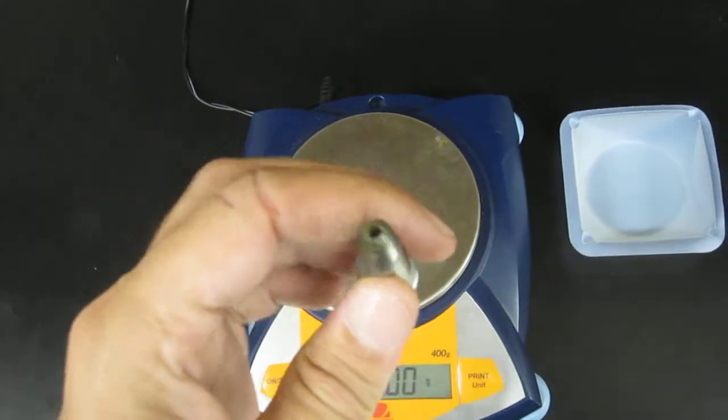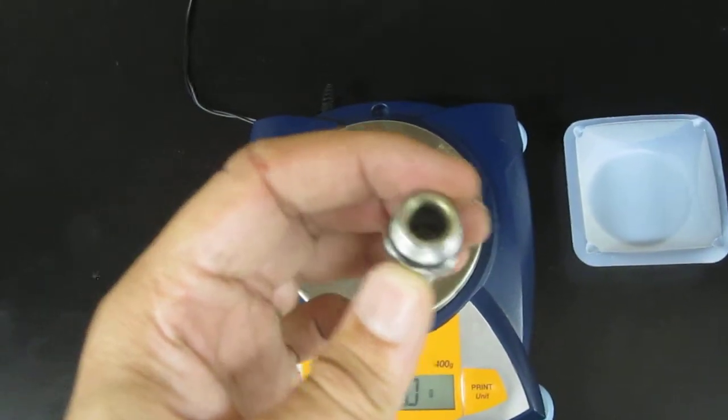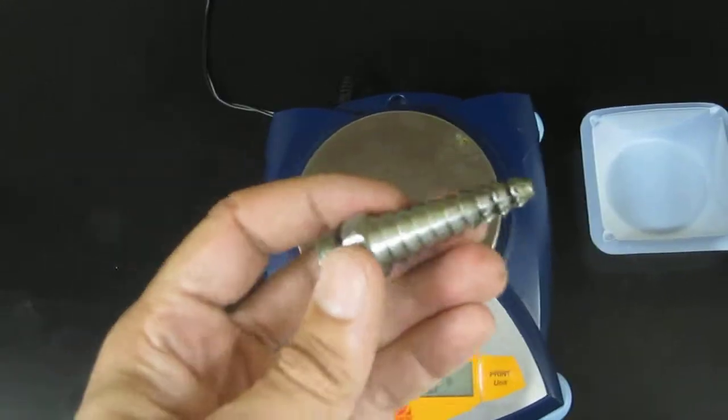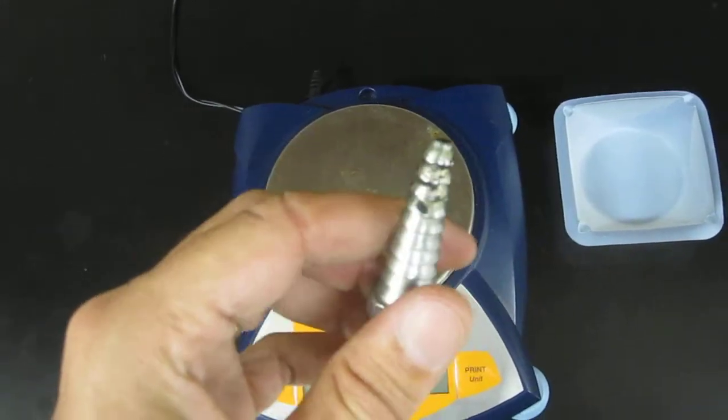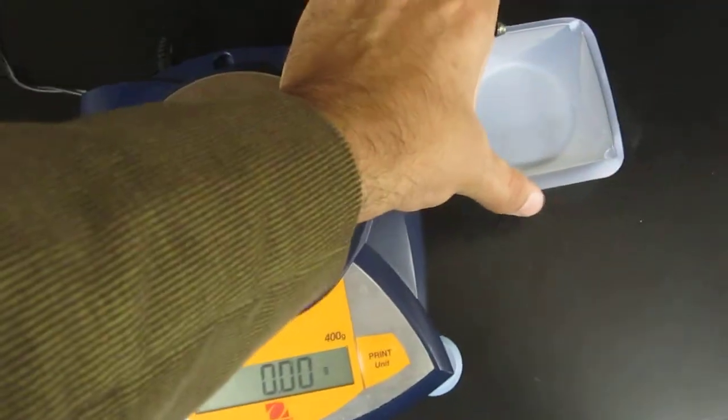It's actually the spigot from one of the lab sinks. So it would be hard to measure specifically the volume of this thing and then subsequently the density. So we are going to figure out how to do that in a couple of steps.